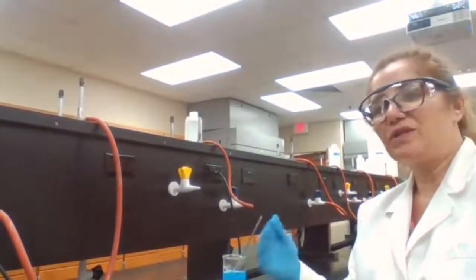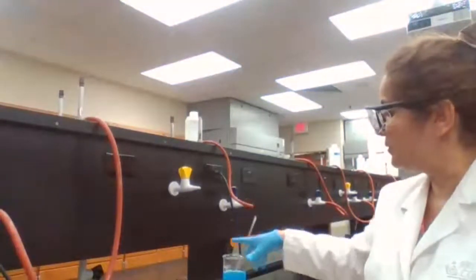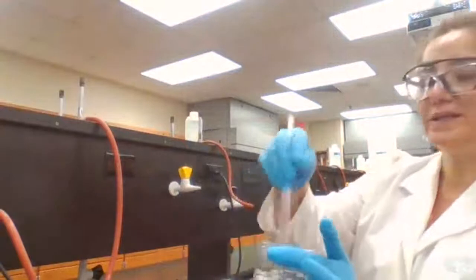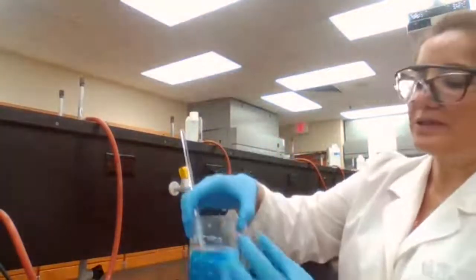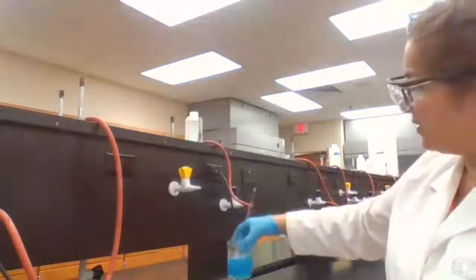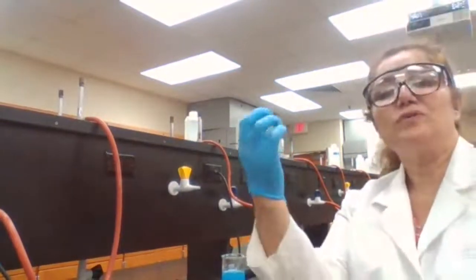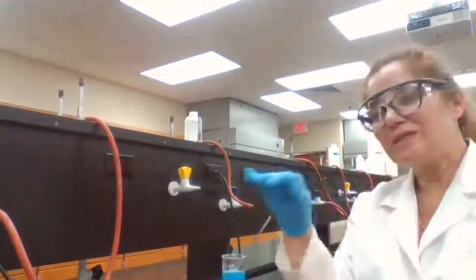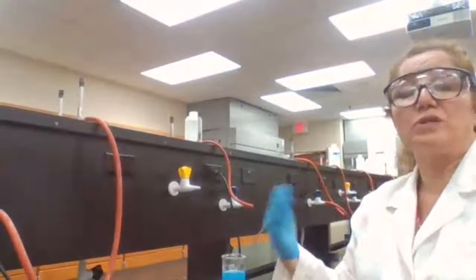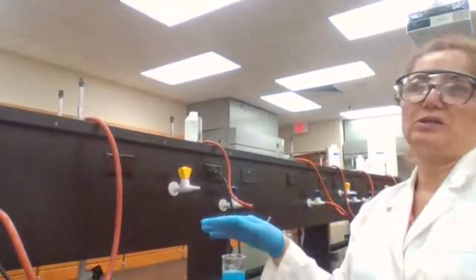It looks like a blue color, like a slushy, or like the gel that you said, but it's particles of the solid that are moving around in the liquid. If we leave it alone, it's going to settle down. And then you could see the solid layer at the bottom and the liquid on top. So the solid has formed, but not the whole thing changes to solid.